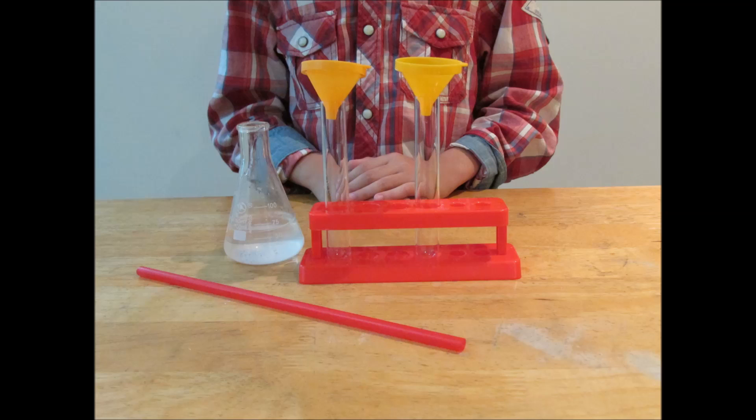You can find out if carbon dioxide is present by using a chemical called lime water. We showed you how to make lime water in a previous video. We want to show the presence of carbon dioxide in our breath.